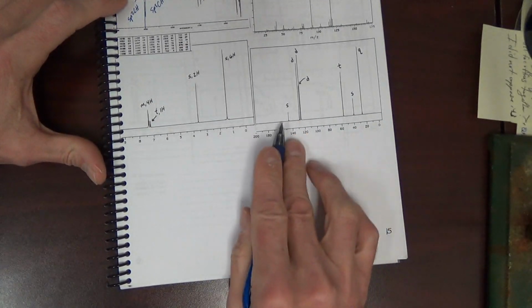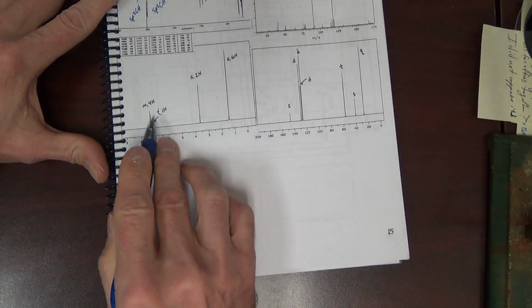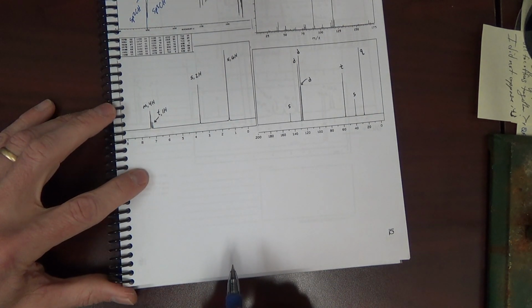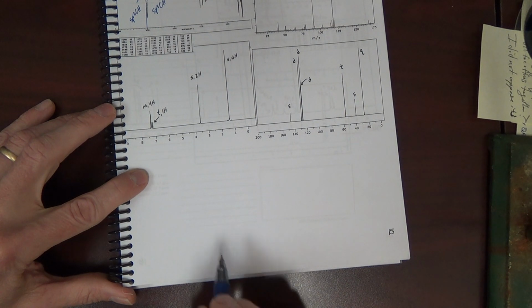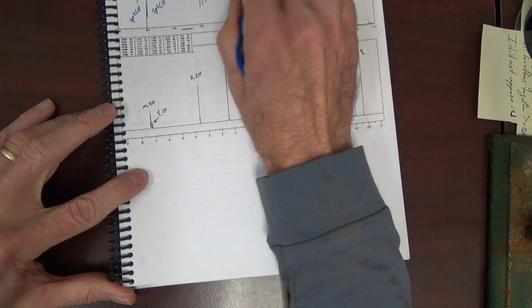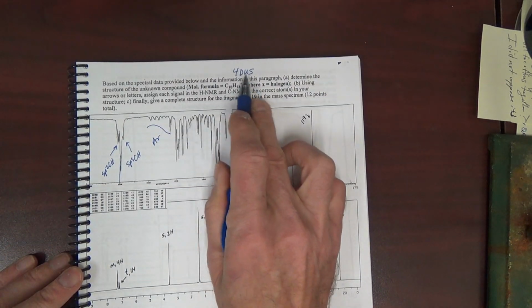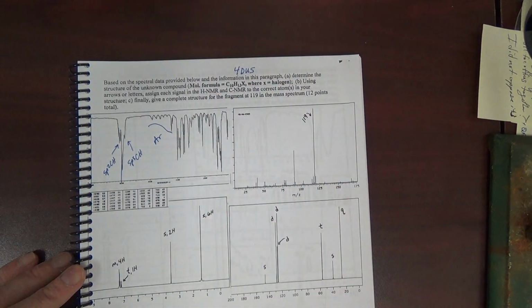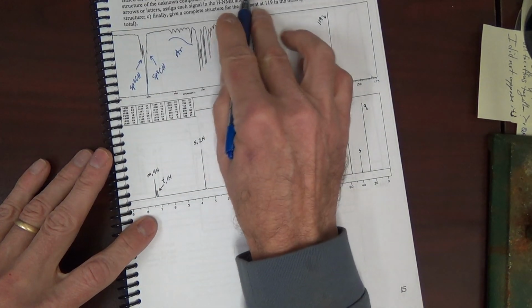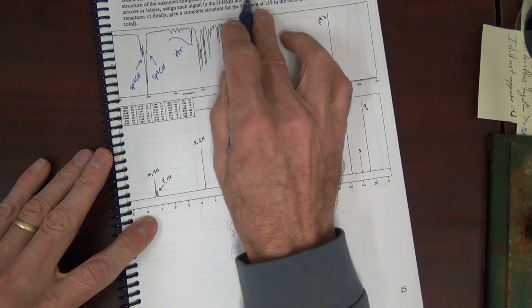We have aromatic signals in the carbon NMR. We have aromatic protons in the proton NMR. Looks like a benzene ring. Thus, if it is a benzene ring, that's your 4 DUS. That means there's no additional pi bonds or rings. So this compound cannot have an alkene or a carbonyl, etc. We know it doesn't have a carbonyl anyway since there's no oxygen.